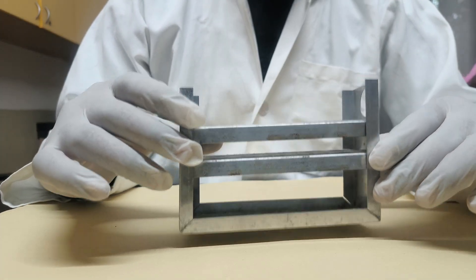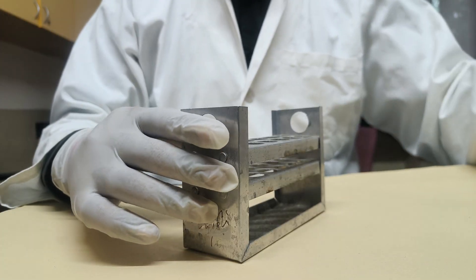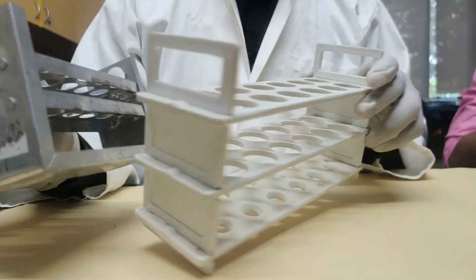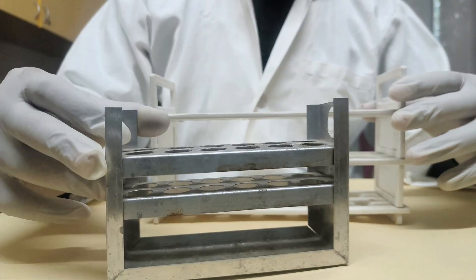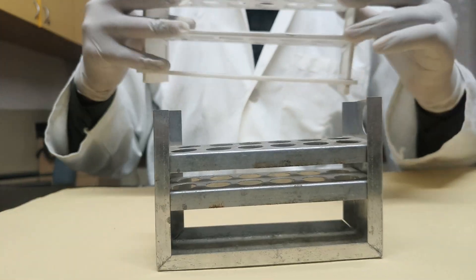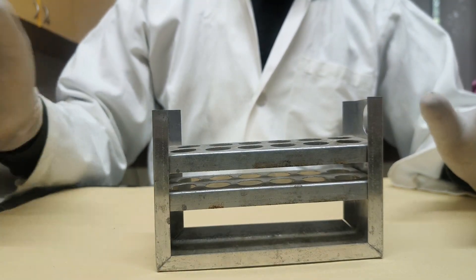Next is the test tube rack or test tube stand. It is used to hold the test tube in an upright position. It comes in two types: metallic and plastic. The metallic type is used for hot test tubes so it will not melt when holding heated test tubes.